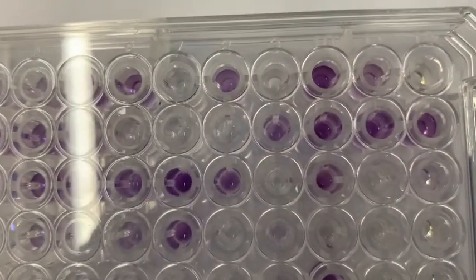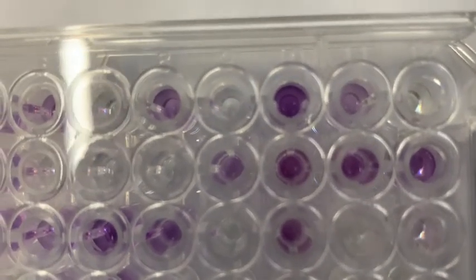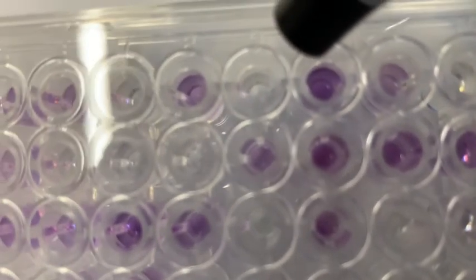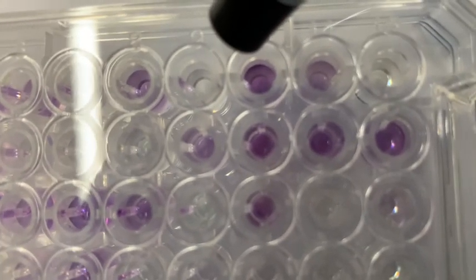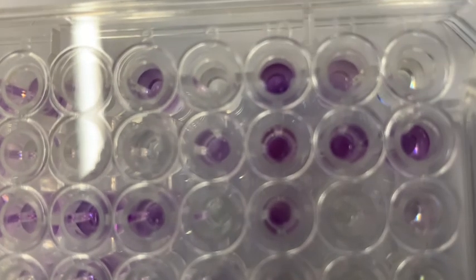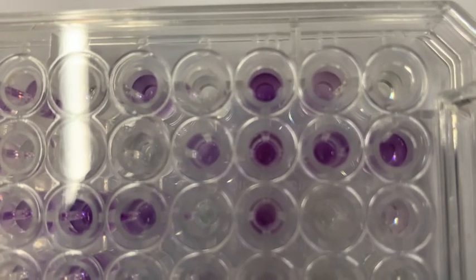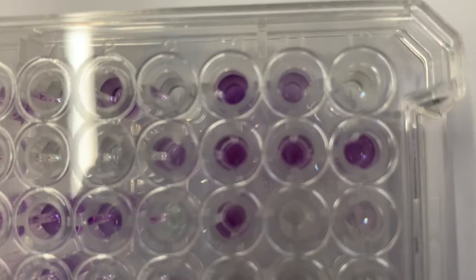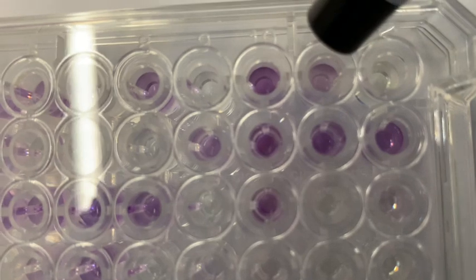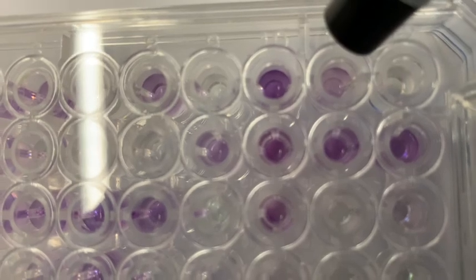All right, now there's another well besides the negative control that's really important. And this one is A10, which is right here. And this one is positive control. So as you can see, it's really purple, and it always should be purple. And you're assaying for whether the well is about 1/2 to 100% as purple. So for instance, A11 here, I would say it's a little less purple, but definitely is at least 1/2 as purple.